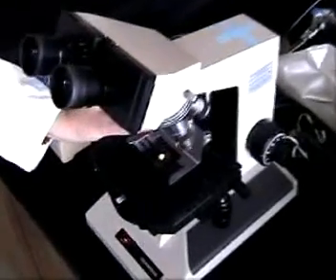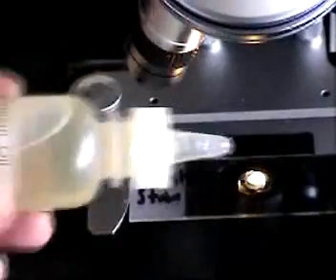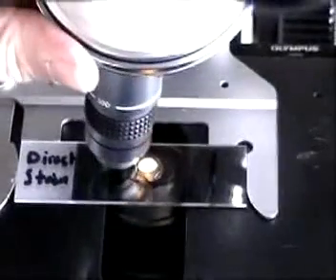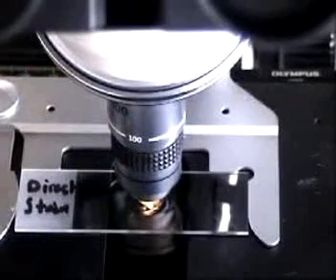Move the nose piece of your microscope so that it's between the 40x and 100x lenses. Put a drop of oil on the slide and swing your 100x immersion lens into the oil.